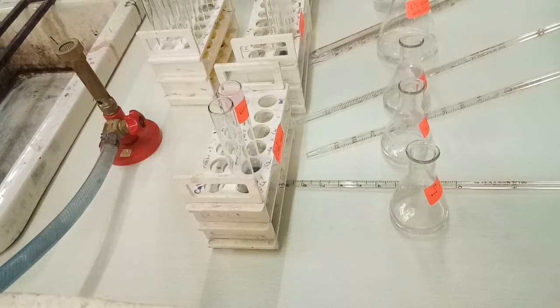Starch is taken in the same quantity, but we have changed only the concentration of enzyme, so we are able to study the effect of changing enzyme concentration in an increasing or decreasing manner, and how it will affect the activity of amylase and the rate of reaction.